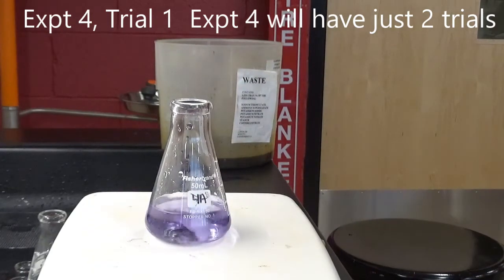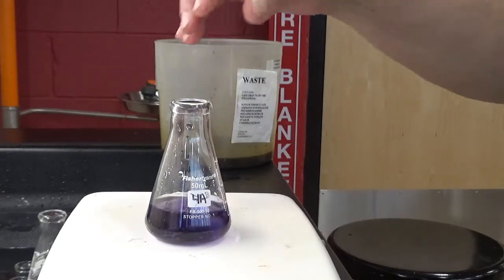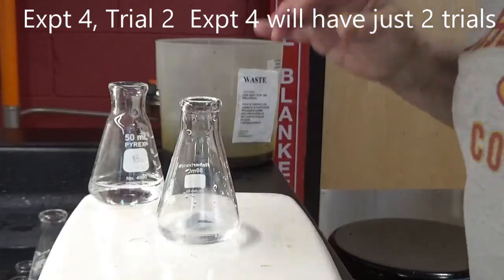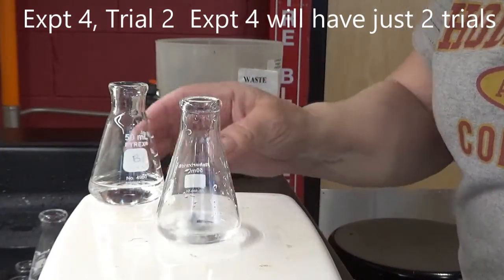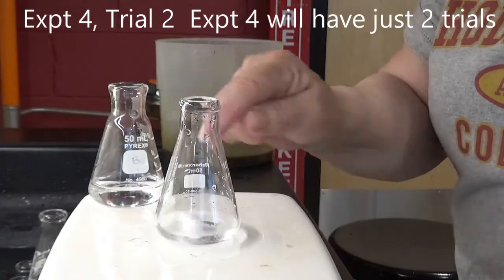Yay. Okay, so that's the end of that reaction. And we're going to do it again. Experiment 4, solution A, solution B.